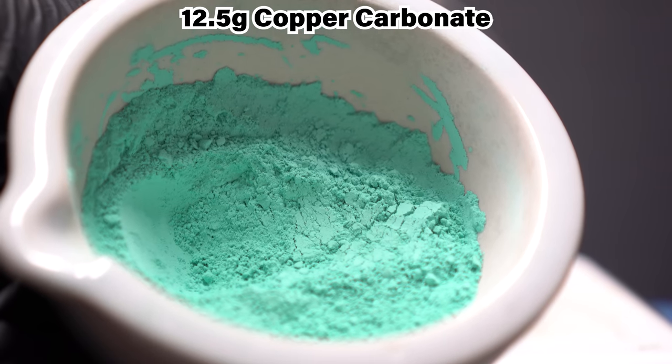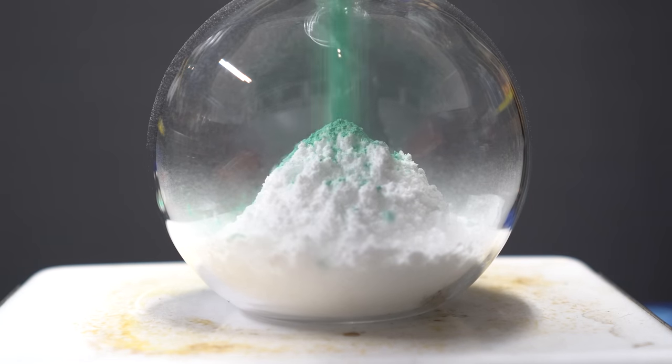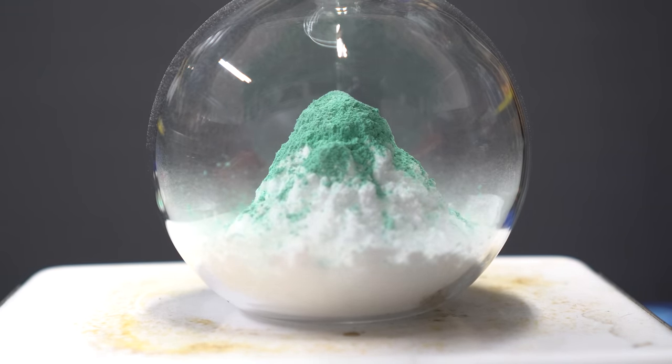For this reaction, we do need a catalyst, and that's going to be basic copper carbonate. I did have to make this myself, as I didn't want to pocket the expense for it, and I did what we all do, and we watched Nile Red.